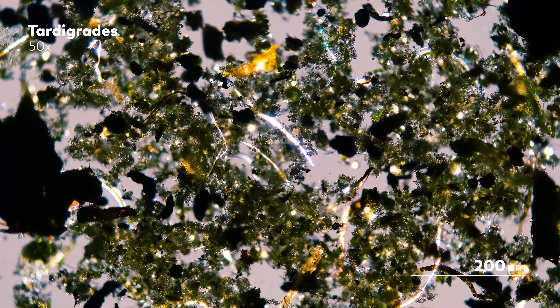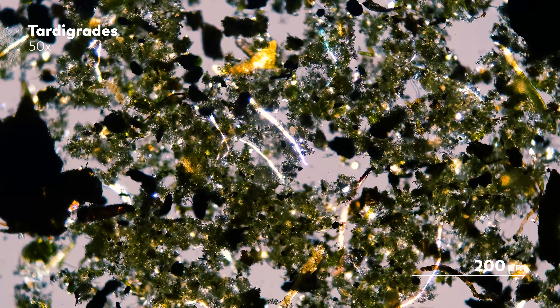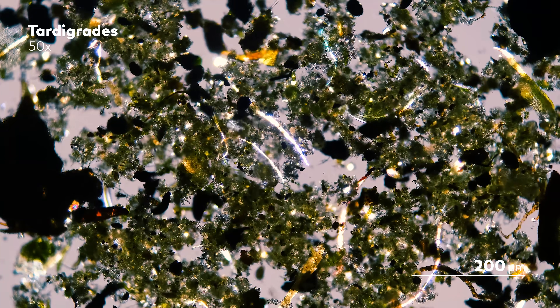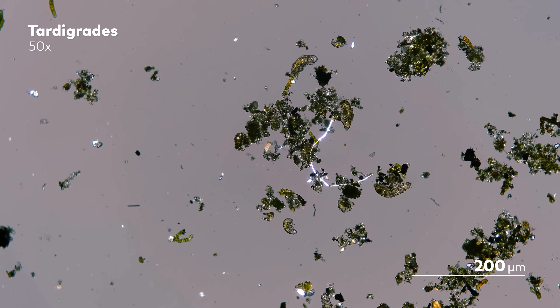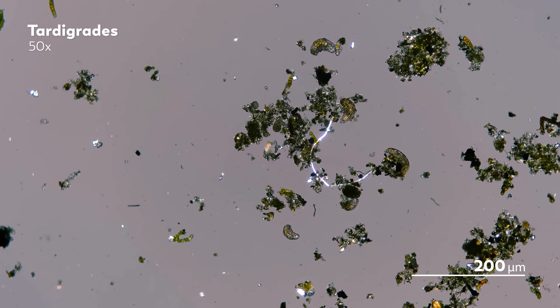If you try the Behrmann funnel out and find that your tardigrades are a bit hard to see because bits of sediment or other things are floating in your sample, don't worry — James had this same issue too. They're kind of hard to make out when there's just so much stuff for them to hide in. He just washed the tardigrades a bit to make them more presentable, carefully pipetting drops of water until there was minimal debris to obscure the view.